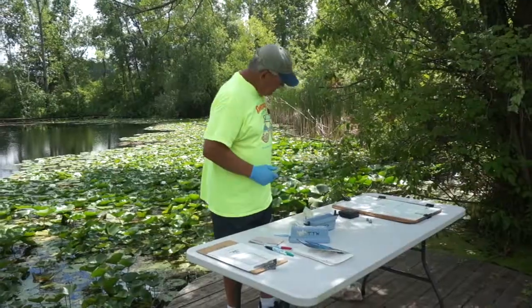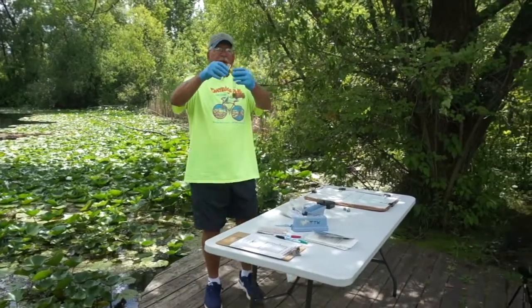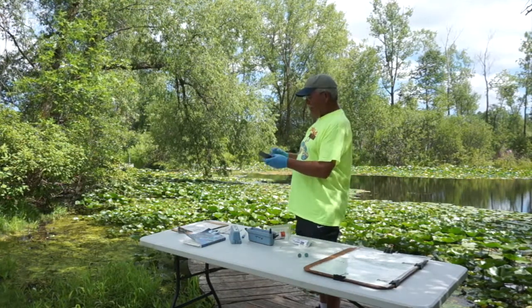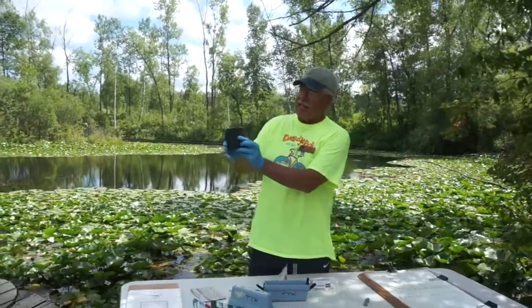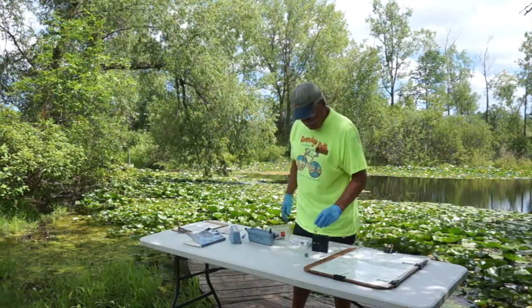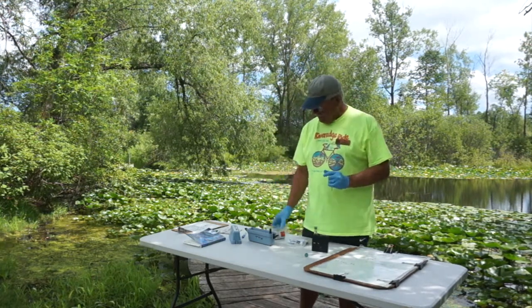The way I always do a test like this is really very simple. You've got two test tubes in front of you. I'm going to go down to the pond here and get myself a sample of water. I fill it up to the top, then I pour my water in here until I get it up to the five milliliter mark — that's the white line at the bottom right there. I go to my black box. Notice the water's got a little bit of a yellowish color to it, so I'm going to place that on the left side over here, and that'll give some background color that'll cancel out when I put my other sample on the other side. I set that there and put one of these little rubber stoppers on top. This is the sample that we're going to test. Remember, you read the bottom of the meniscus — you want about five milliliters in there.